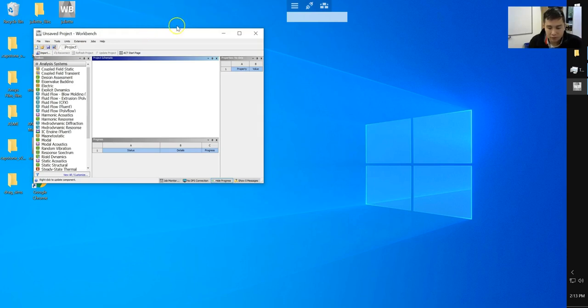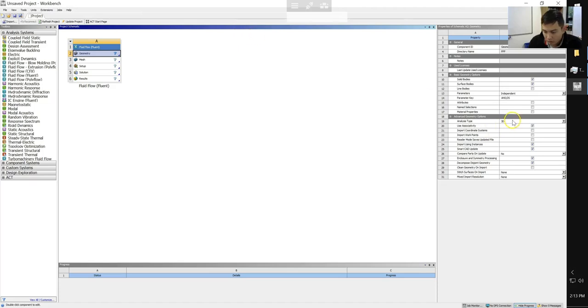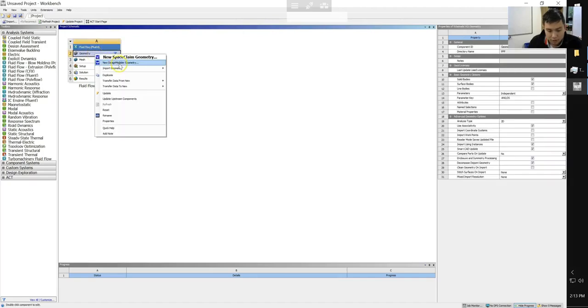So we have my VMware system loaded up. I've gone ahead and opened Workbench. We're going to start up our Fluent simulation geometry. We're going to set our property as 2D and go ahead and open up our Design Modeler.